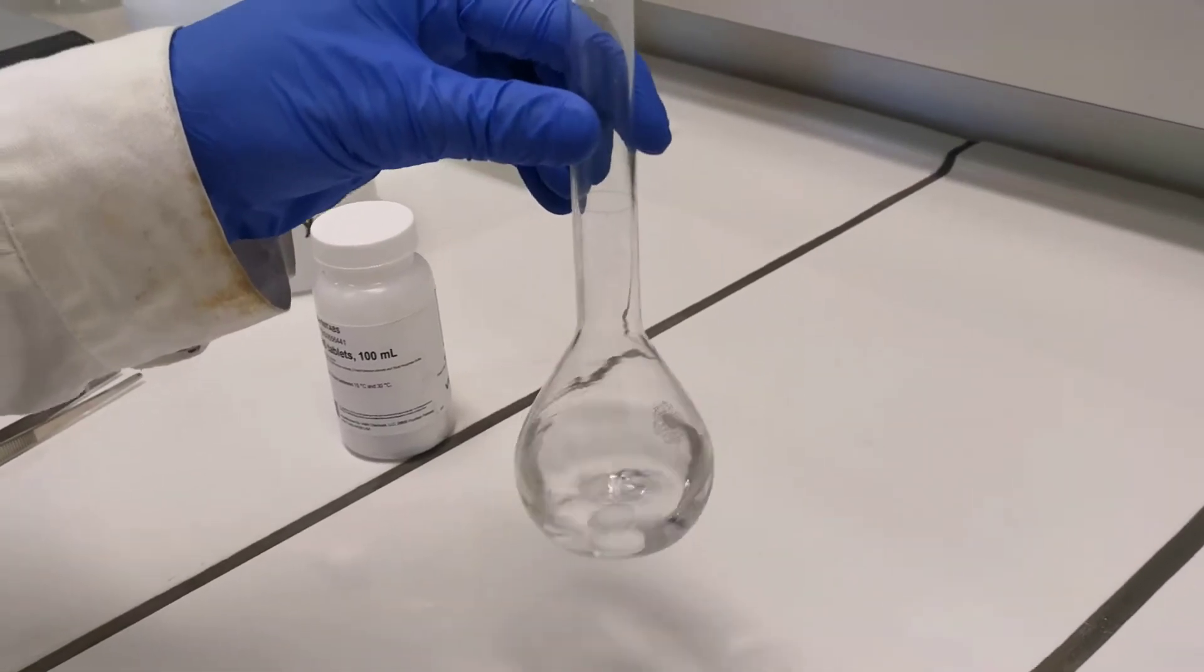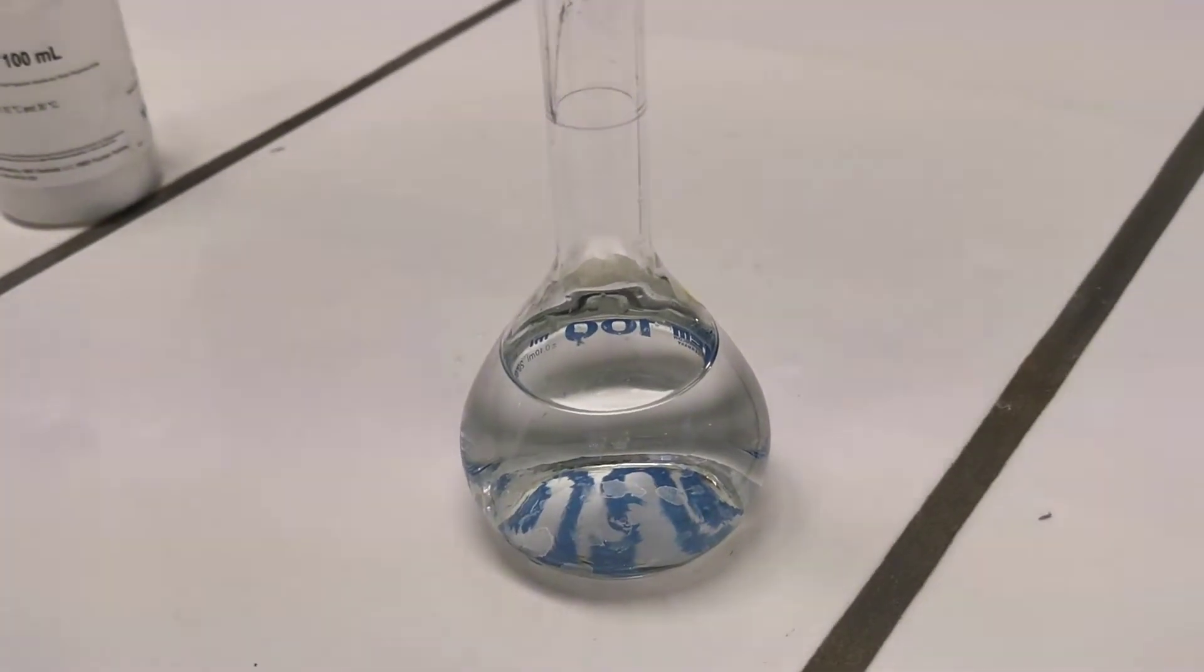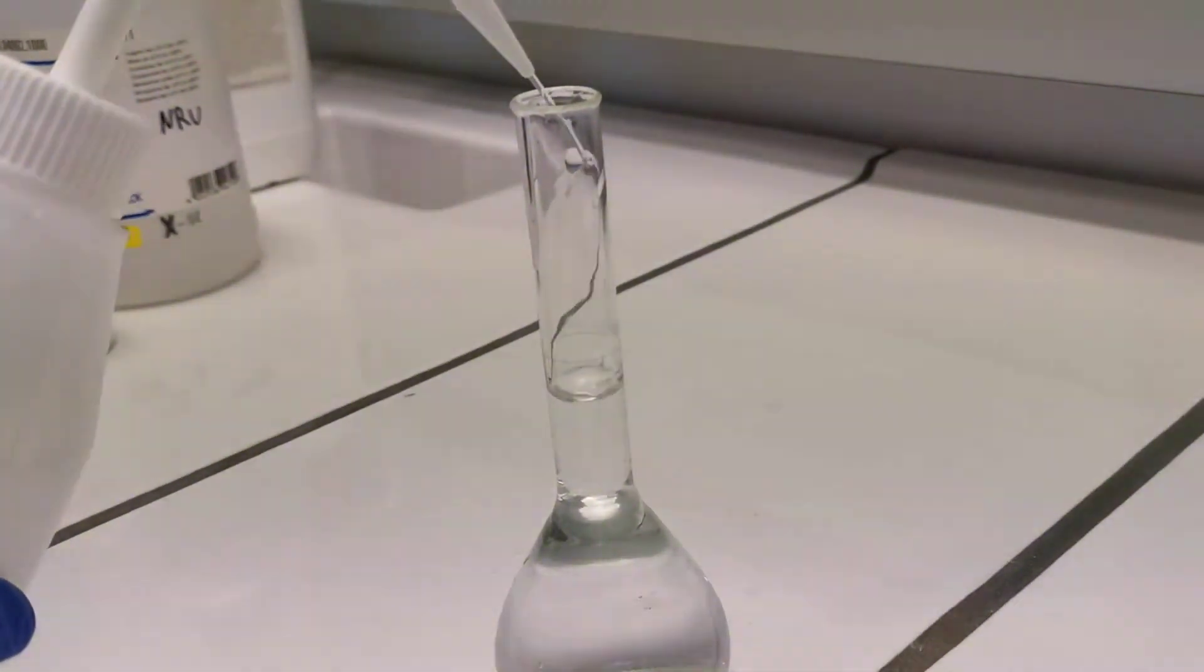It takes a few minutes to completely dissolve the tablets in the water, and in the meantime, our formaldehyde is cooled down to room temperature.